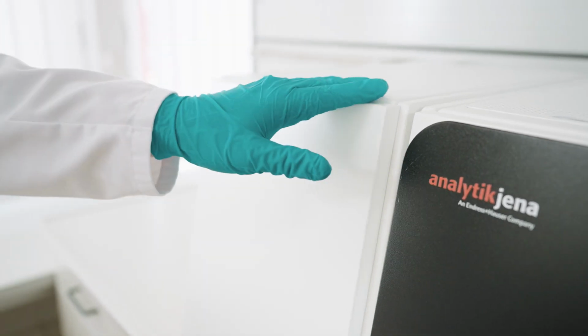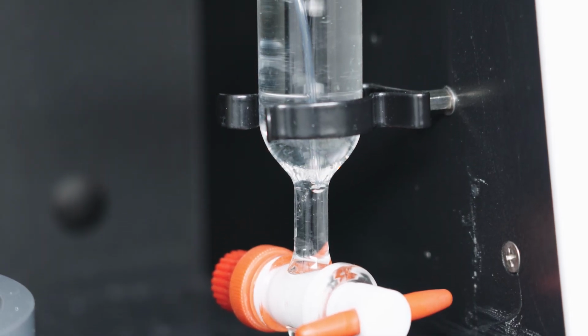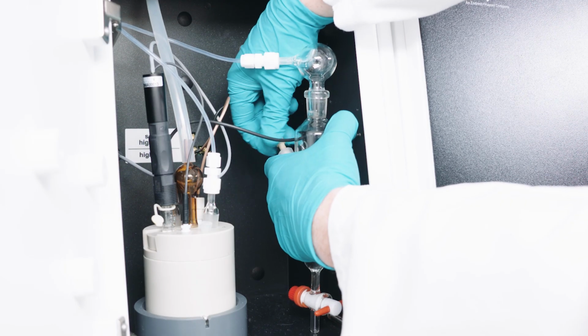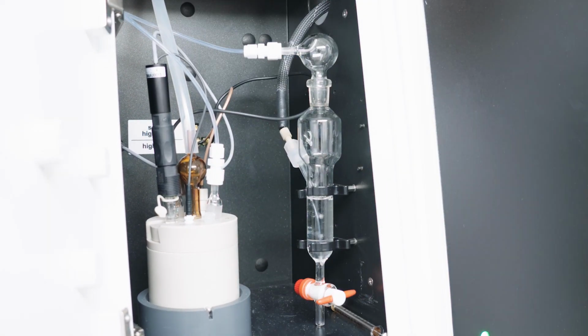Especially in chlorine analysis, ultra-low detection limits and high precision can only be reached if the titration and drying system is properly maintained, dry and clean. The quantitative transfer of the formed HCl gas is of crucial importance. Important preconditions for this are efficient drying and a prevention of adsorption and condensation losses. Only this way reliable analysis results can be gained, especially in the ultra-trace range.